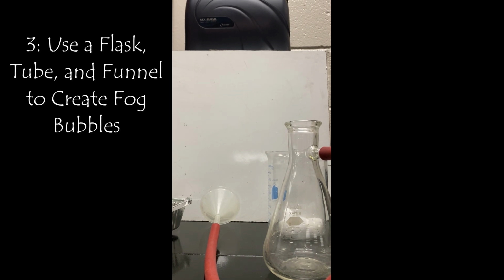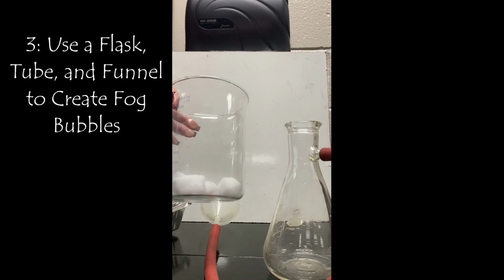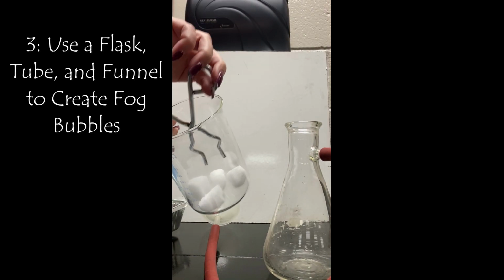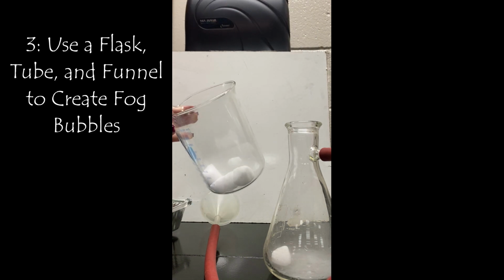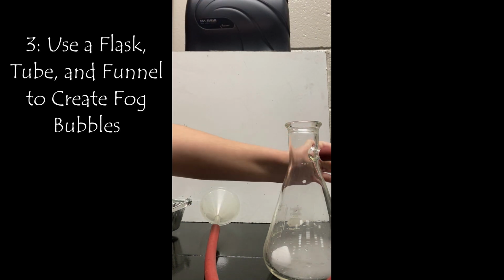Okay, the next one we're gonna do, we're gonna have a flask and we're gonna hook it up to a rubber tube of some sort. And then I put a funnel at the end. So just make sure it's secure and that a whole lot of air cannot escape out. I'm gonna go ahead and drop one of the chunks of dry ice straight down into the flask.